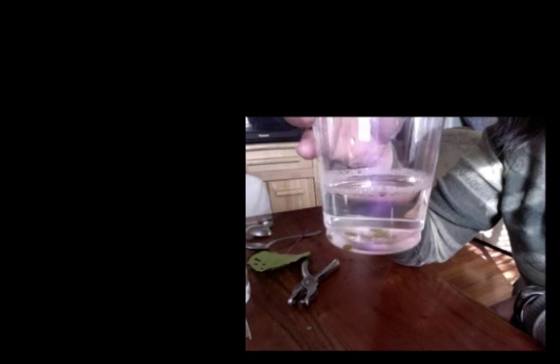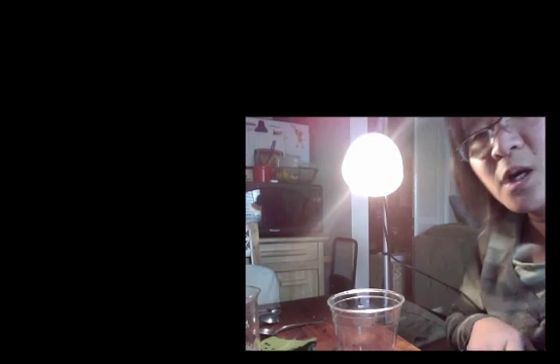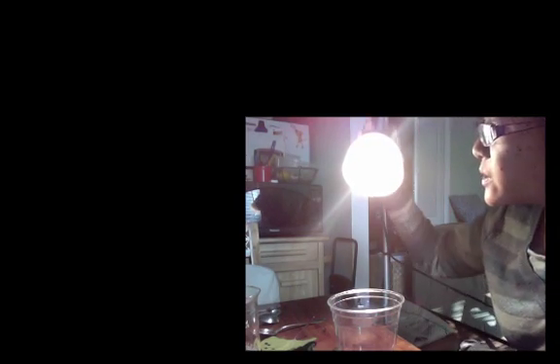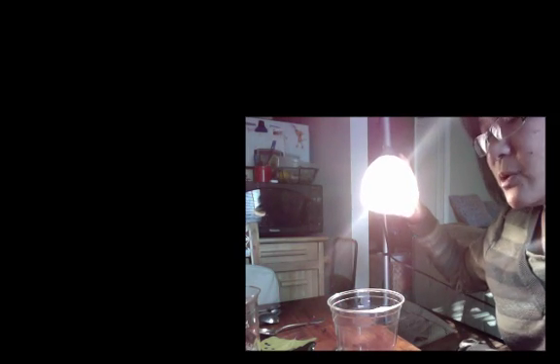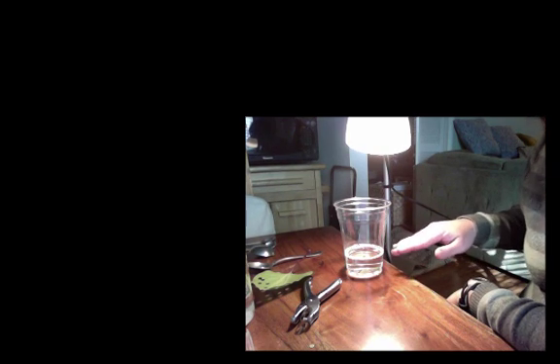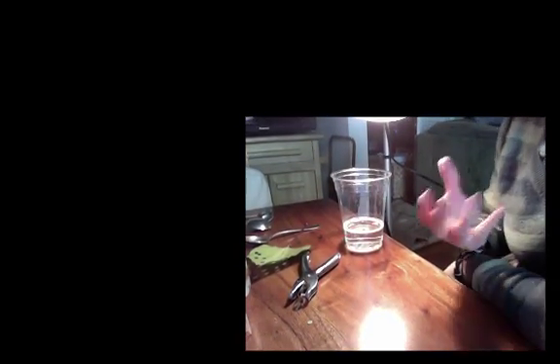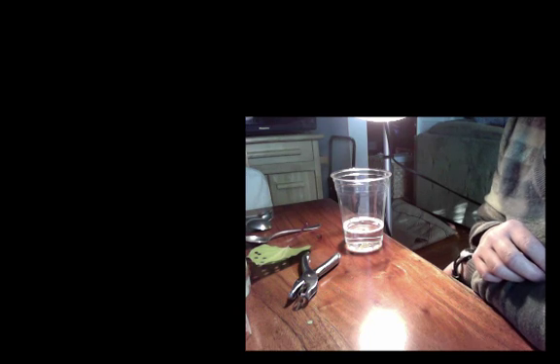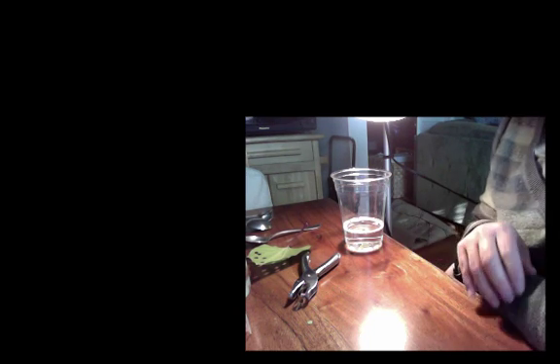I can put this under a light source and I'm going to count the number of rising disks over time. Okay, what I did here was I got a lamp. Your lamp is going to be one of the table lamps. I'm going to go ahead and put my cup right below the lamp so it gets maximum exposure. Sometimes there will be a lot of soap bubbles on the top of the actual solution and if that's the case you're going to want to use a glass rod to kind of push the bubbles out of the way because it's affecting the amount of light that's actually getting to the leaves. So I'm going to leave it like this and just kind of keep an eye on it. See what happens over the next 15 minutes.